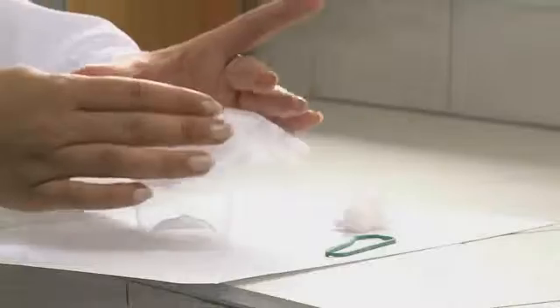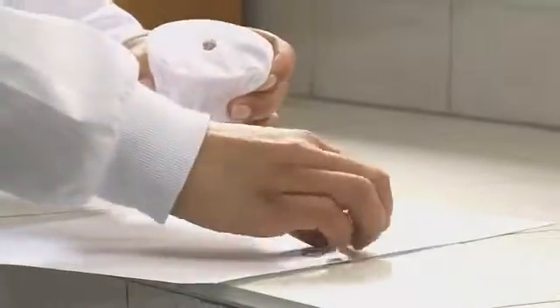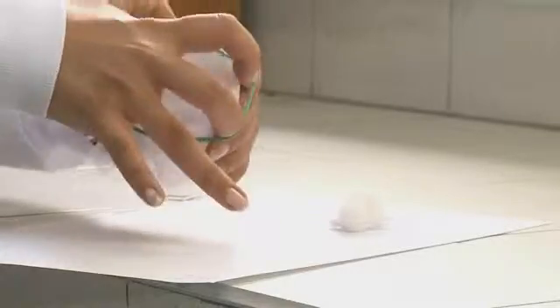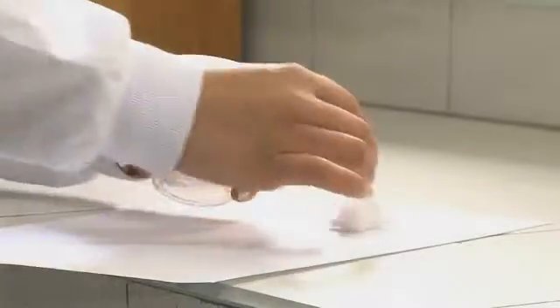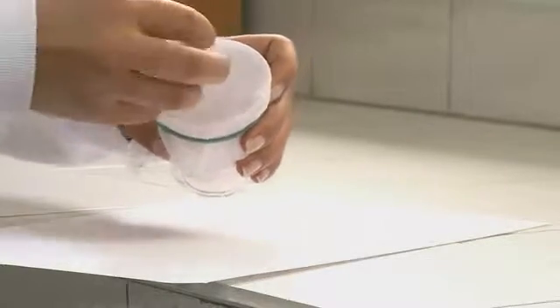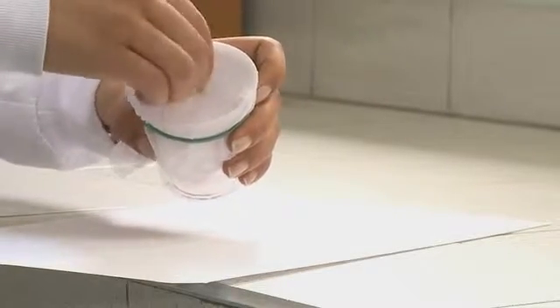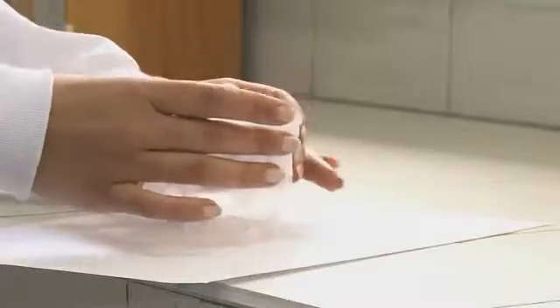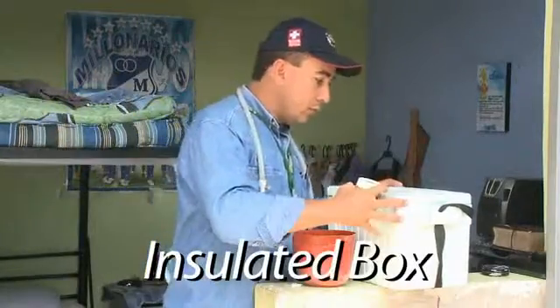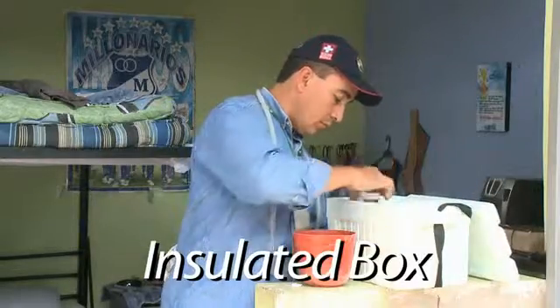A collection cup is made using an unwaxed paper or plastic cup, a piece of mosquito netting with a hole for insertion of the sucking tube, a rubber band, and a piece of cotton wool as a stopper. A cardboard box or an insulated box is useful in transporting captured mosquitoes.